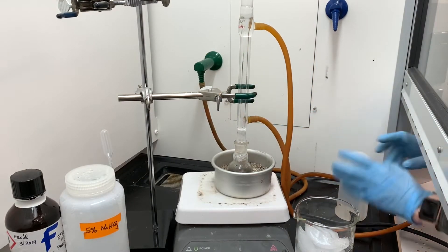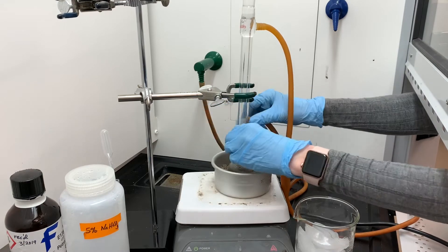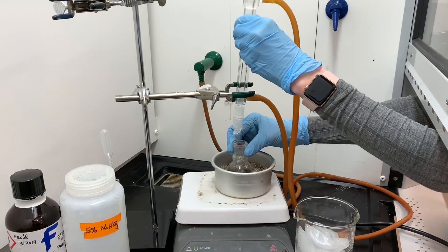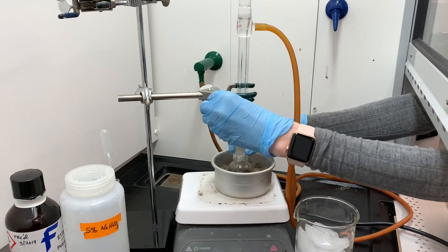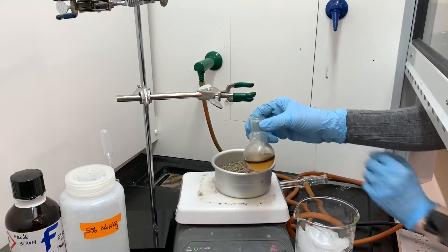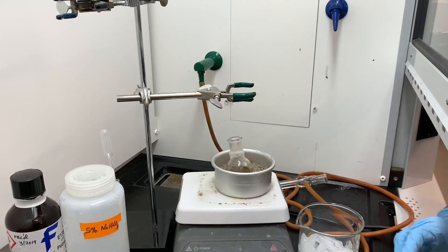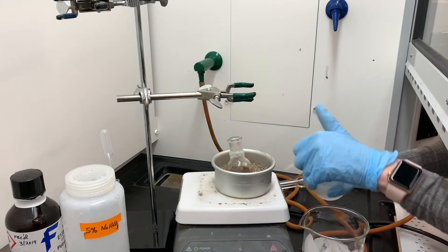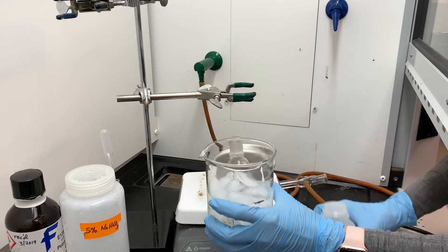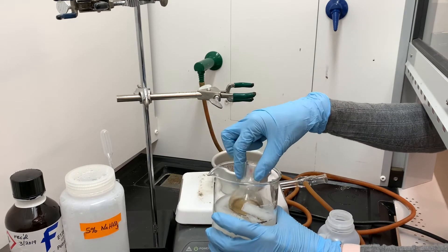This has been heating under reflux for about 35 minutes, so the reaction is done. I'm going to disassemble the glassware and let it cool down before going through the process of separation and purification. Notice the pretty significant change in color, and it looks like we now have two layers inside that round-bottom flask — a definite indication that the reaction is complete. I'm going to let this sit in an ice bath to cool it down and make it easier to work with.